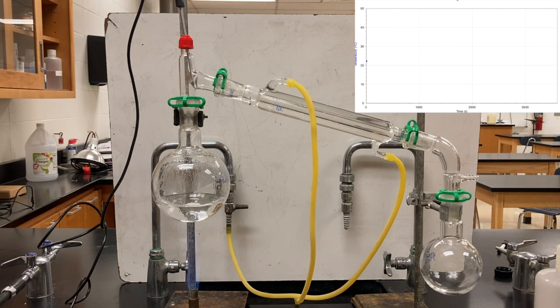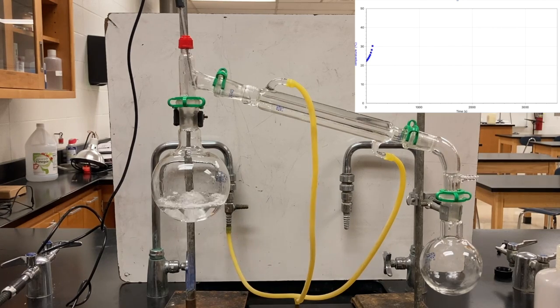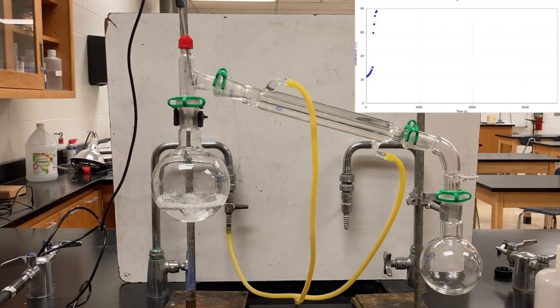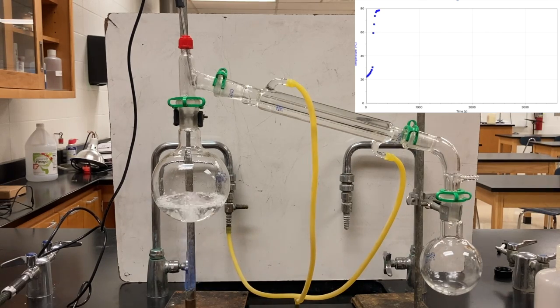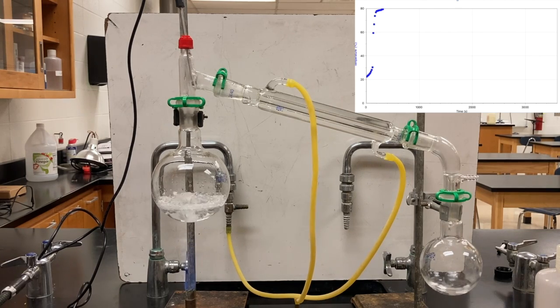And now I've moved the graph off to the corner and we'll watch the distillation. Now this takes a while and so it's going to be a lot of just watching water boil, basically. But I'm going to speed it up. You can see there's a rapid rise in temperature going on as this boiling is starting to take place.